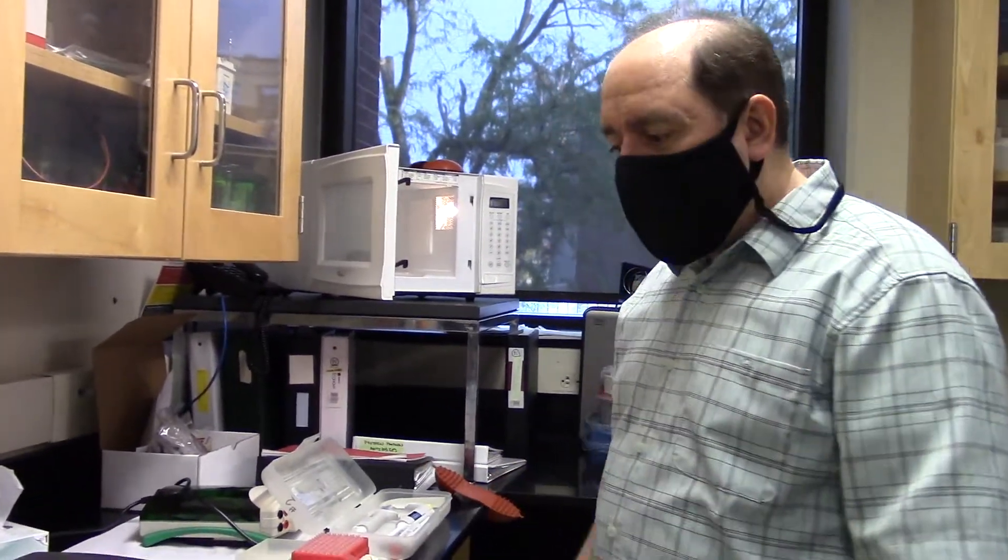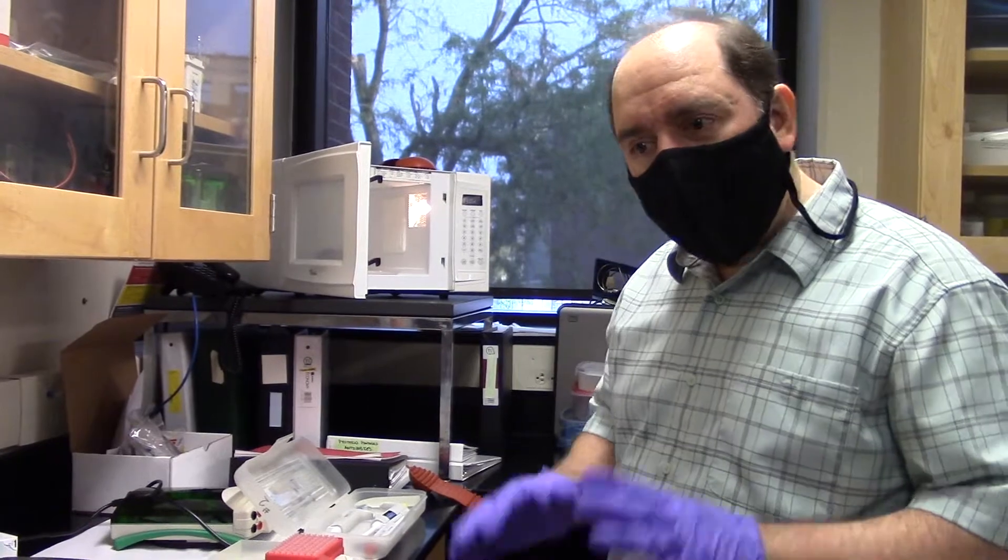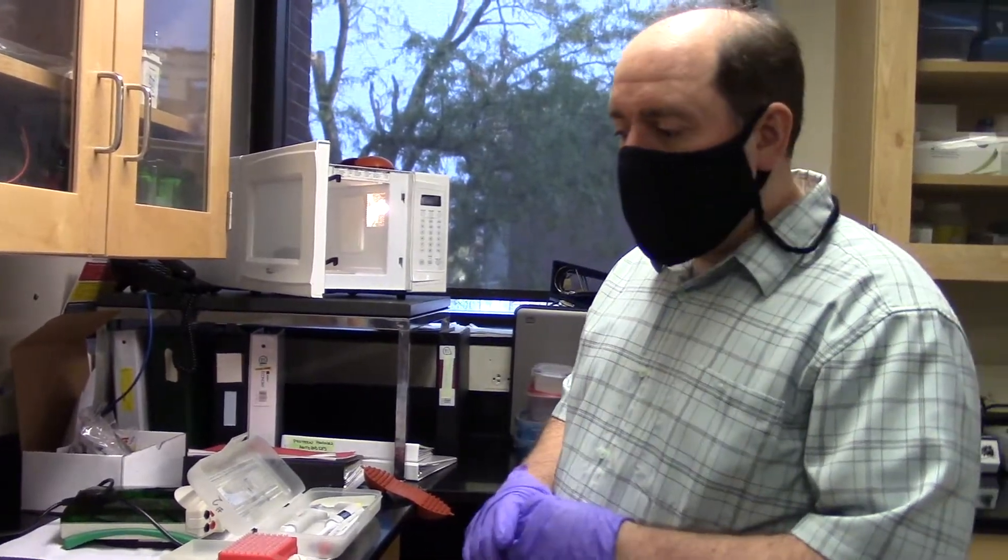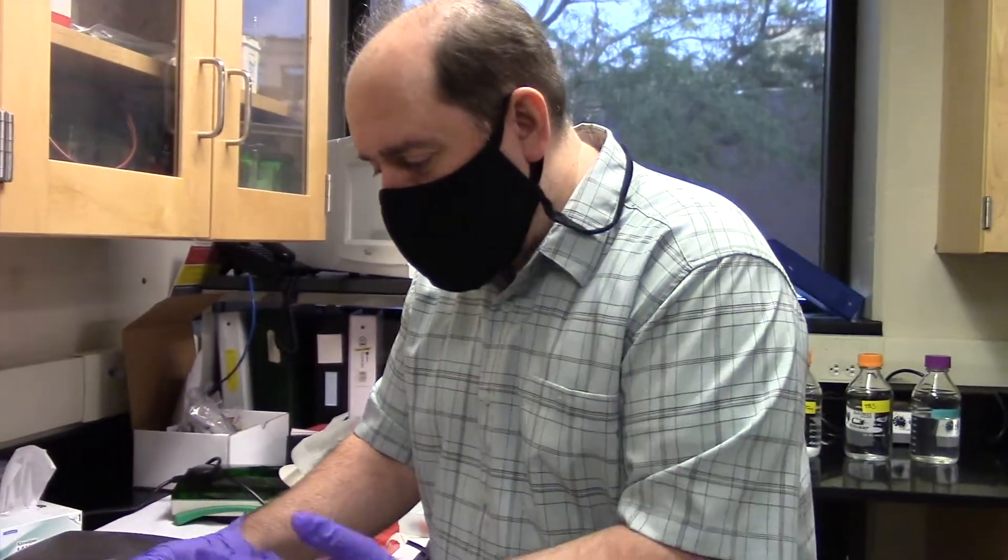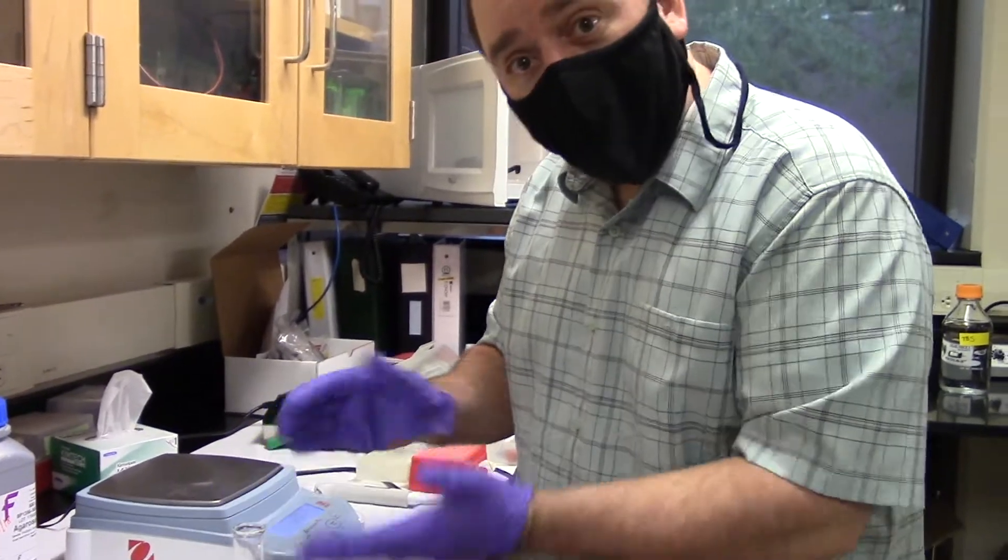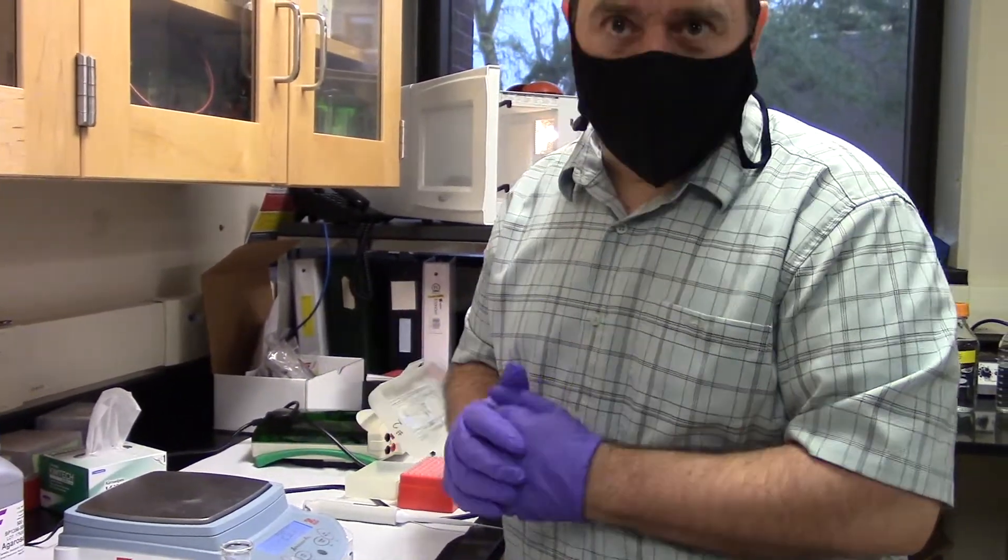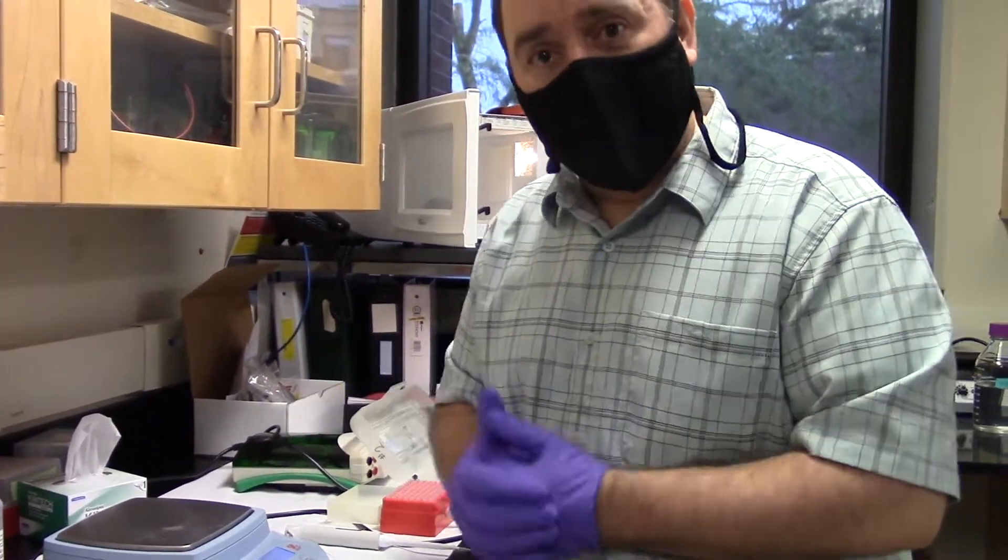Now I'm going to let it cool for just a few minutes, maybe five minutes, such that I can pick this up with my hand and touch the part that was just boiling and not burn myself. At that point, we're getting ready for the next step.